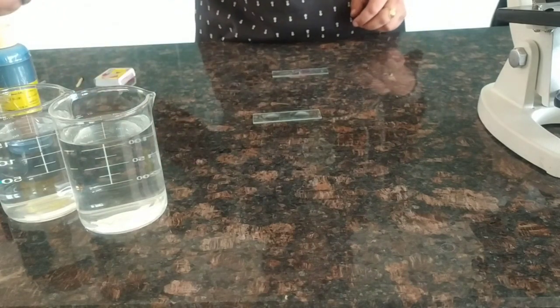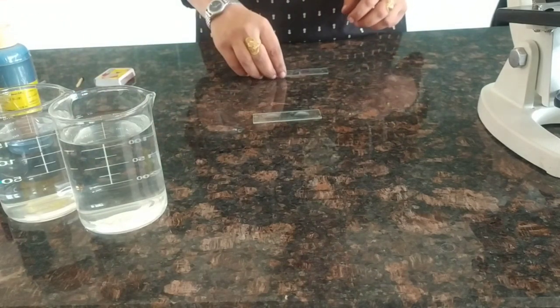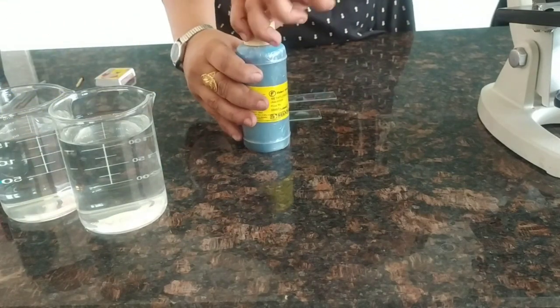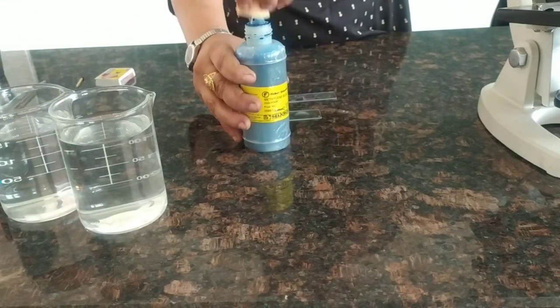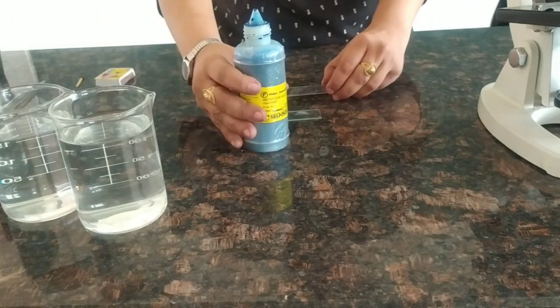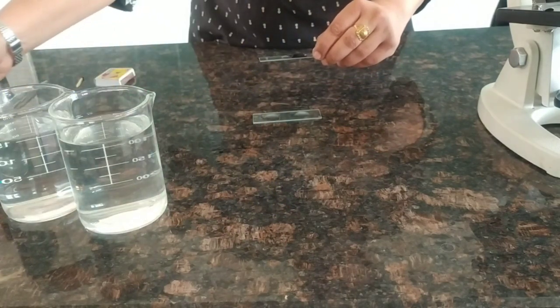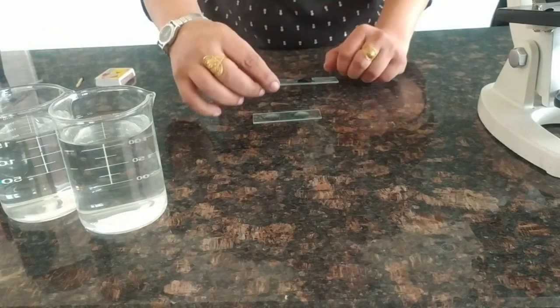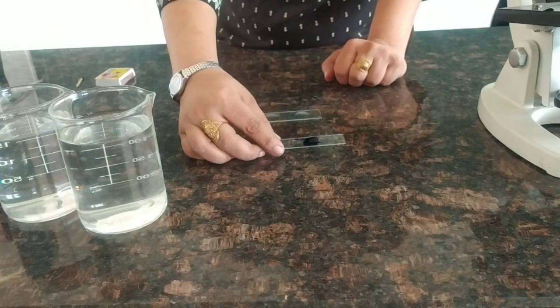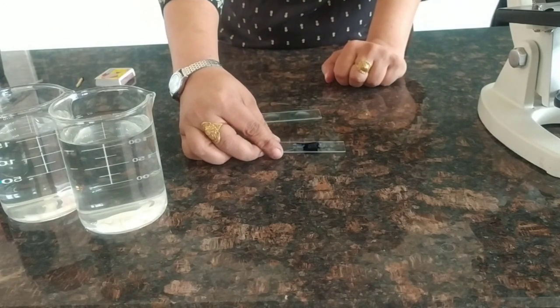Now we will add a drop of methylene blue to the slide and let it dry for some time. When it gets dried up, then we'll give it a wash and observe it under microscope.